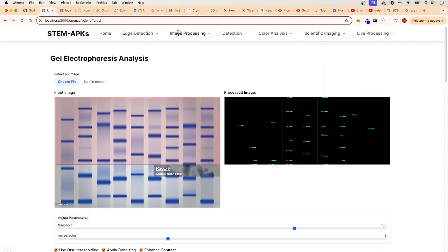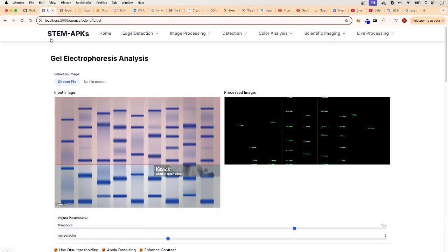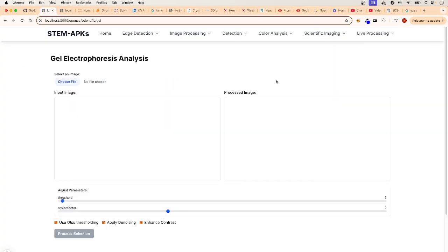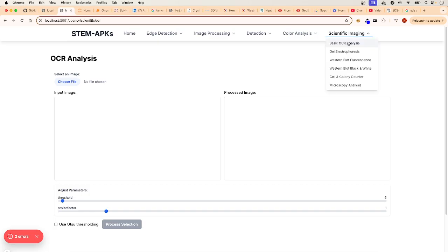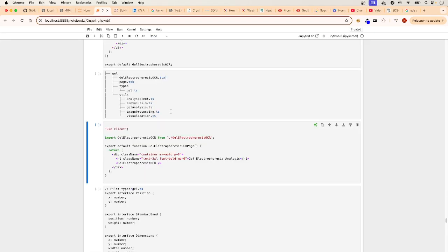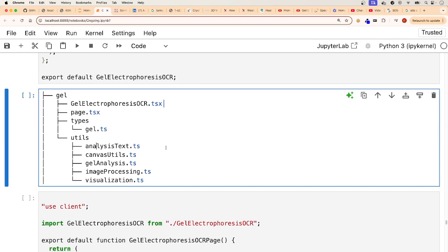So let's do that. As you remember, this is what our application looks like. This is the other one. This is what it's going to look like, but we're not there yet. We're building it step by step, and this is where we are right now. If you click on gel electrophoresis, there's nothing there because we're going to build it together. The first thing, like always, I'm going to show you the tree structure, and let me make this bigger so you can see better. And this is what we're going to build today.